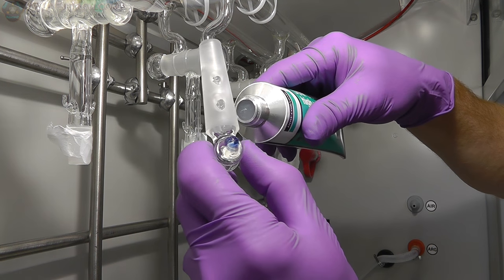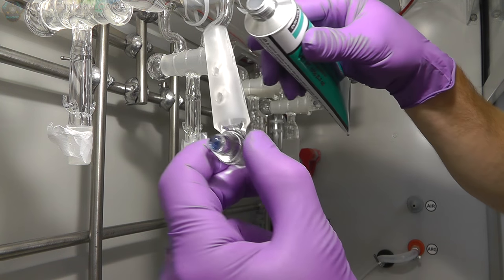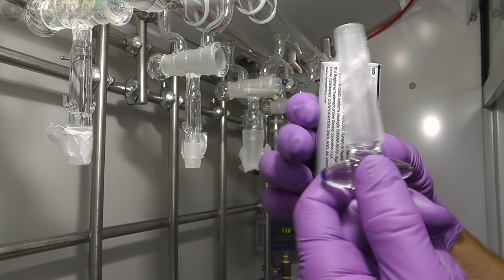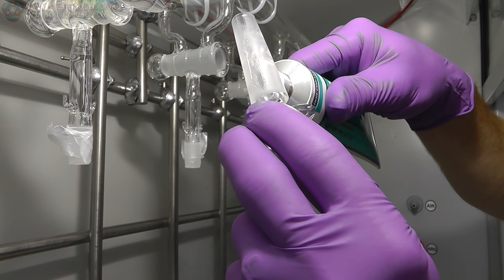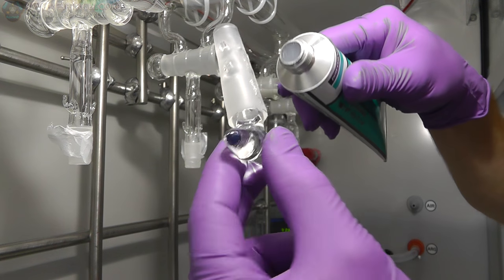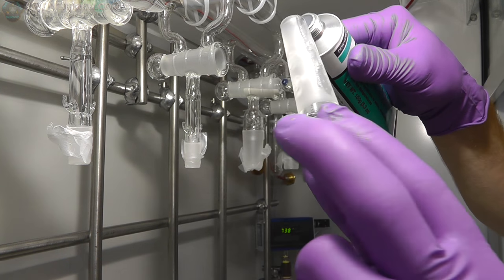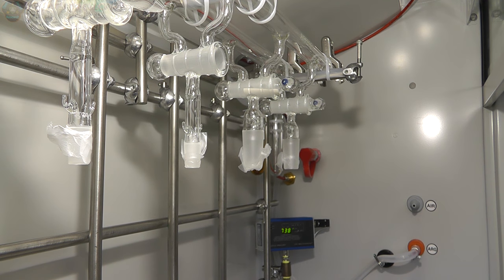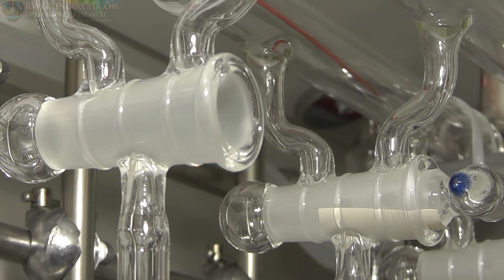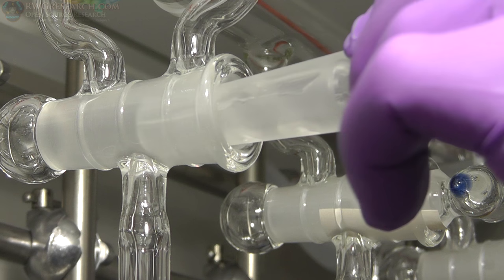So I'm going to apply a very little bit of this. Very little bit on this side. These are precision ground, so no need for a bunch of excess. So that should be enough. Alright, let's give it a shot. I may need to add a little more, but we're going to try it.